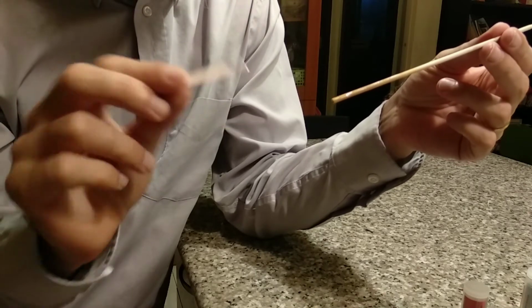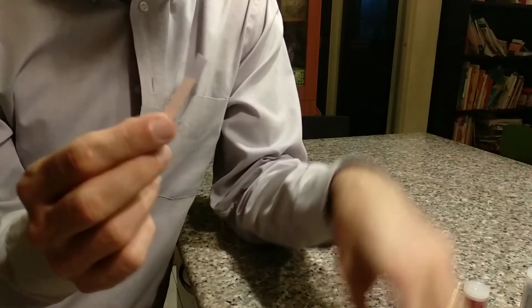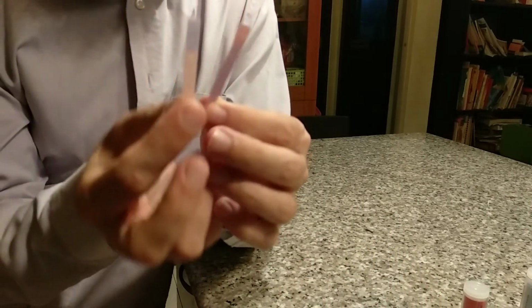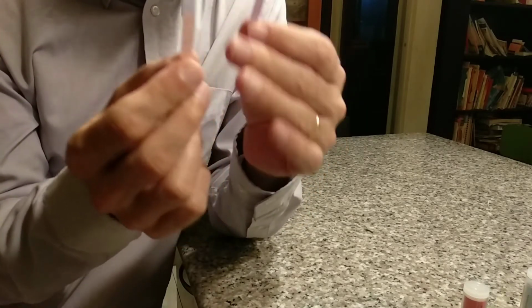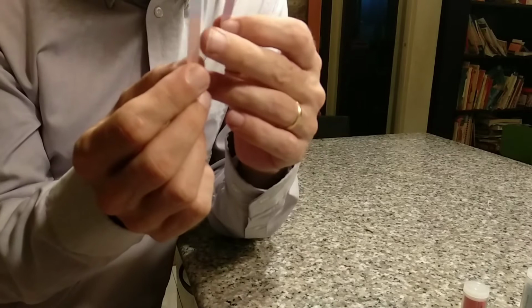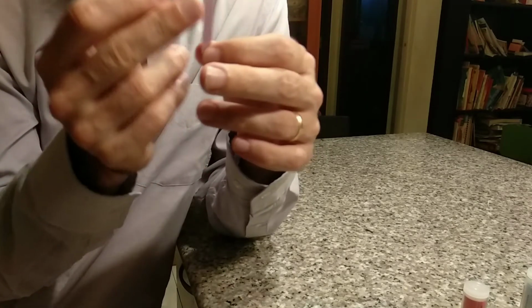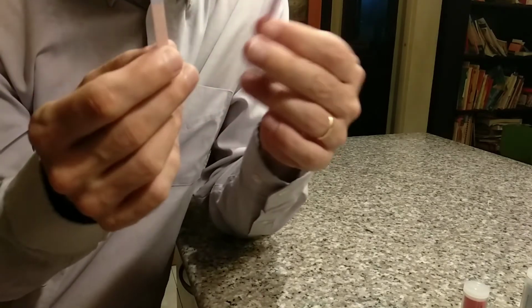Oh, it goes from the red to the blue. Okay. So in the end, are these two separate things, the red litmus paper and the blue litmus paper? No, it's the same thing. It's just the red litmus paper starts out just a little bit acidic. The blue litmus paper starts out just a little bit basic, and then you can go from there.